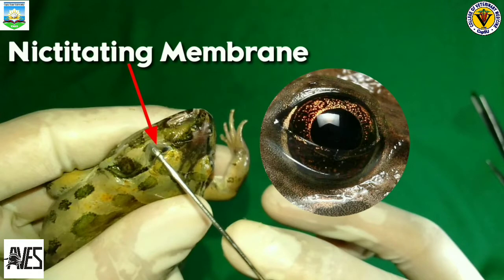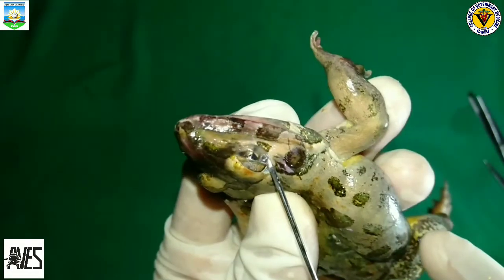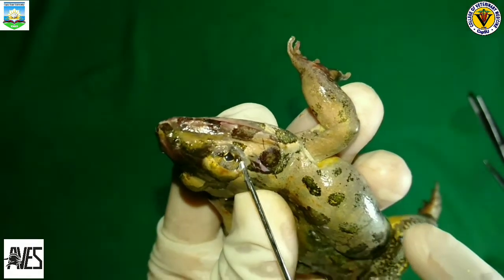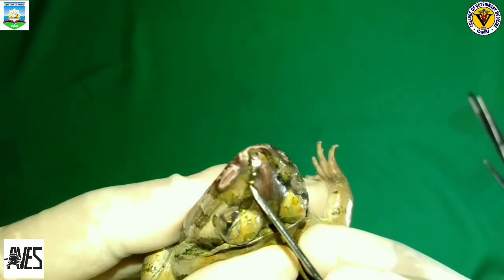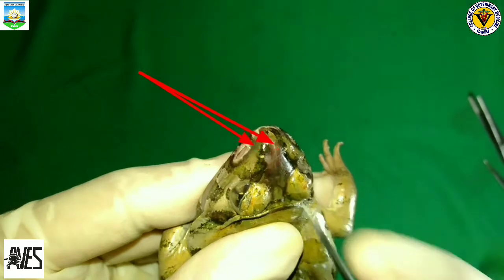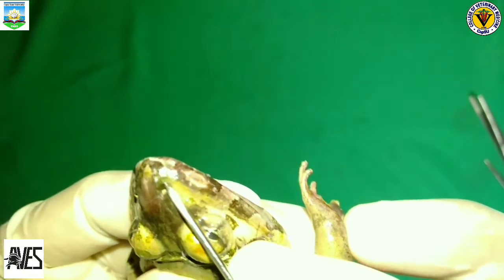Frogs' nictitating membranes provide a protective layer over their eyes, letting the water bounce off harmlessly as the frogs swim underwater. The membranes keep the water out of their eyes, letting them watch where they are going while keeping their eyes protected. This is the external nares of the frog. External nares are located on the top of the frog's nose and look like small slits. This makes it possible for the frog to float on the surface of the water, leaving external nares above the water level for inhaling oxygen.